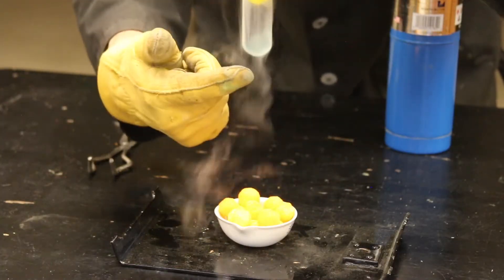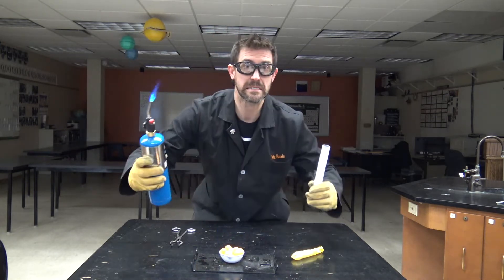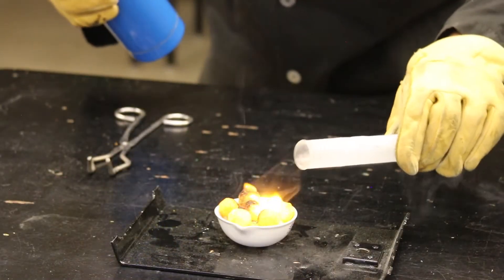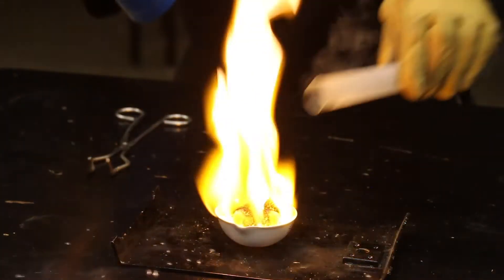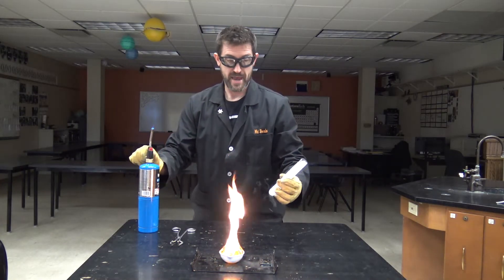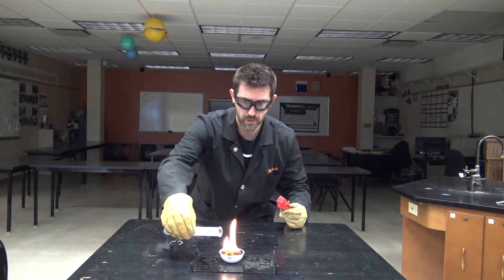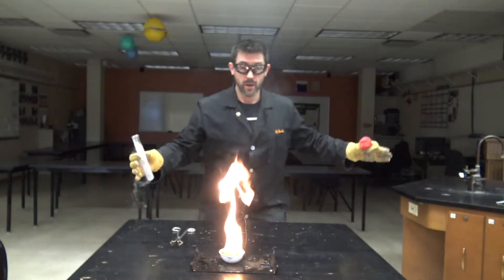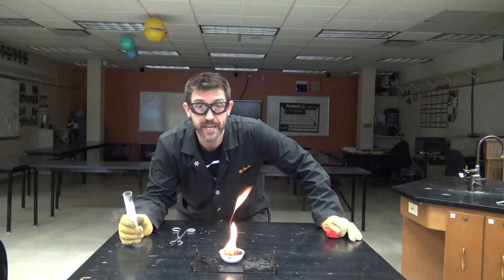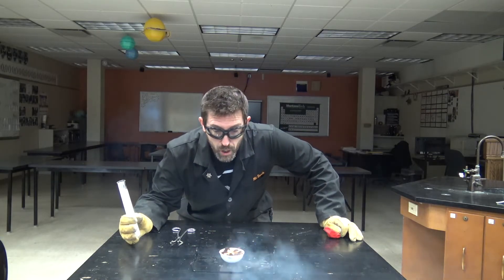Let's do that. I'm going to go ahead and light these up, add some liquid oxygen, and see what happens. A little bit of fire there. Okay, that's much better combustion. Liquid oxygen number two. Can you see anything? That's intensely bright.